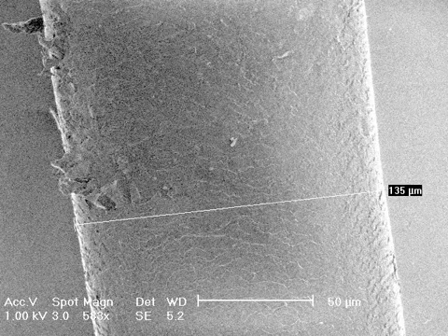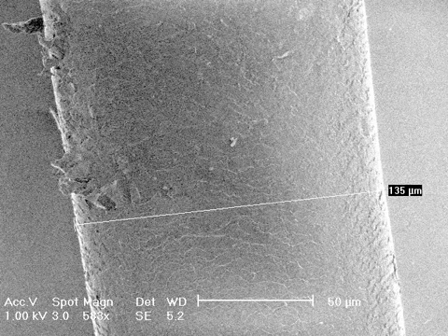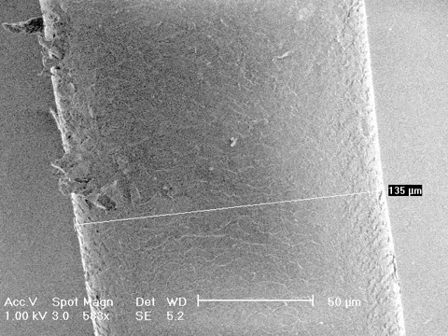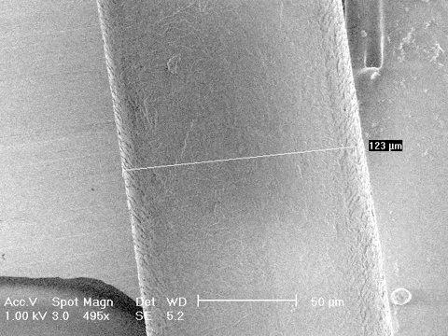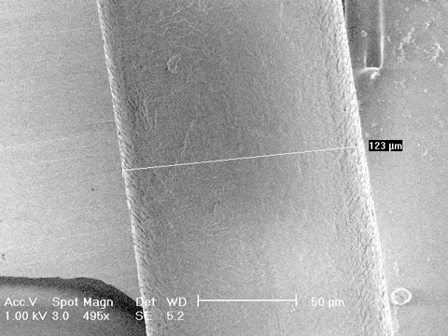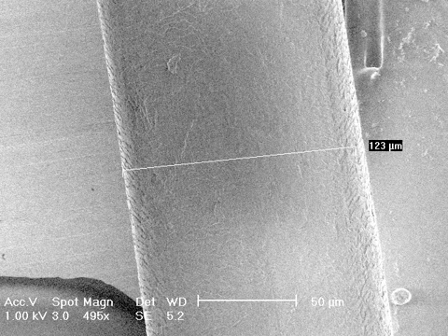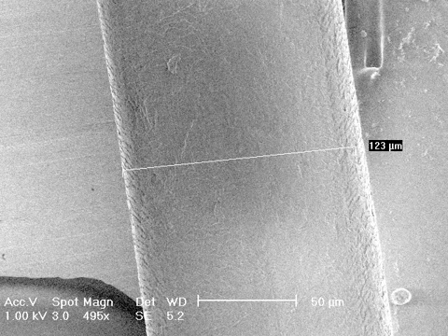Here we measured the diameter at the distance of 1 cm from the tip and the diameter is equal to 135 micrometers. Here is the diameter measured at 5 mm from the tip and it is equal to 123 micrometers.